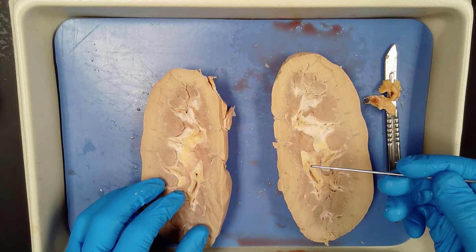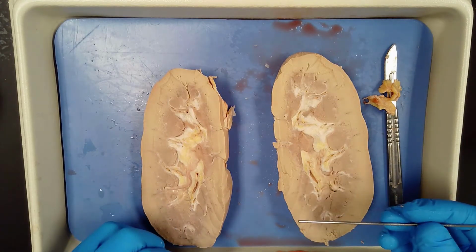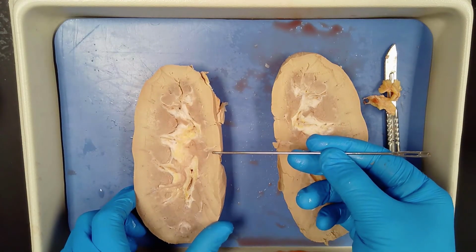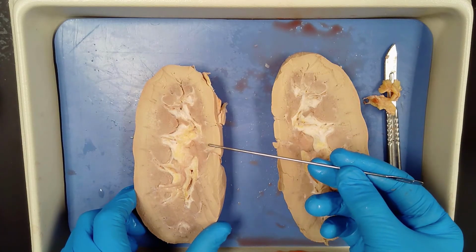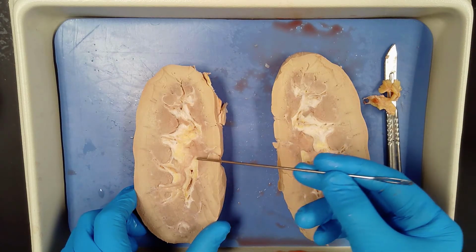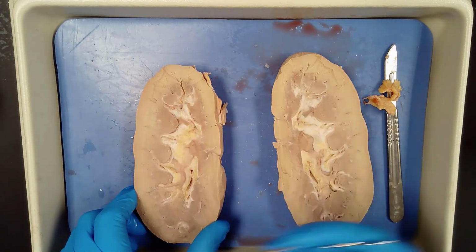Okay, so let's review the pathway the blood enters the kidney. So it comes in here. It comes in this middle portion here. Again, you can't really see it, but it comes in here and it goes through the renal artery, which we're going to make red in the video, and branches out into multiple branches. So it goes lots and lots of different ways because it wants to use this entire kidney to filter.